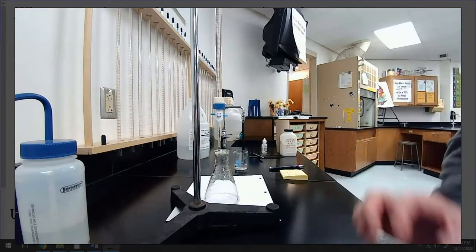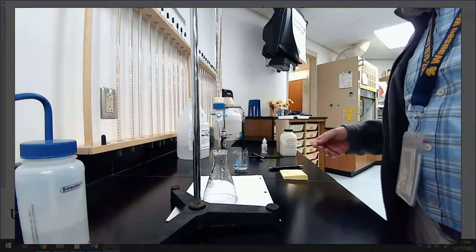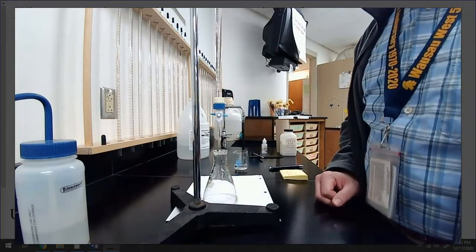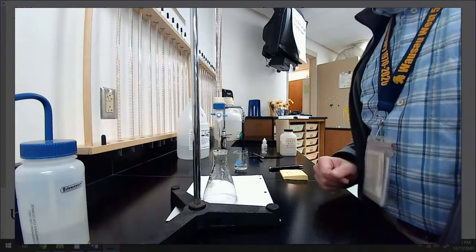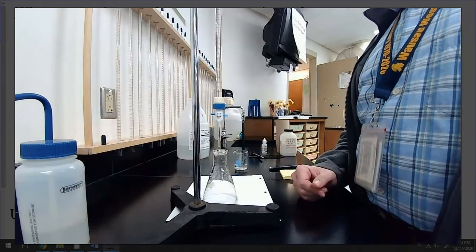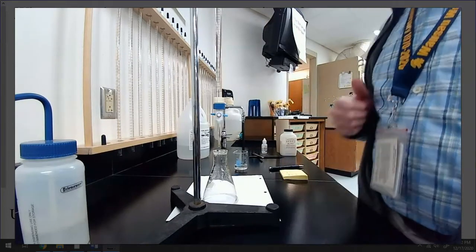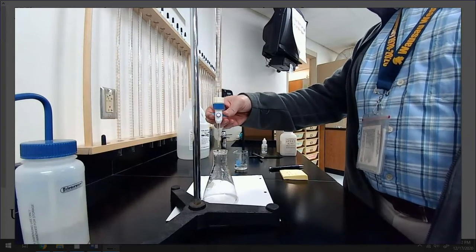I won't bore you. Well, maybe I will bore you. Forget it. I'm quicker now. I know that it's going to be roughly like 13 milliliters, right, from my previous data. In the previous trial, it took 12 point something milliliters. So I know that I can probably just open this up and let it get down to about 10-ish, 11-ish milliliters before I really have to start being careful. So let me just open it up.